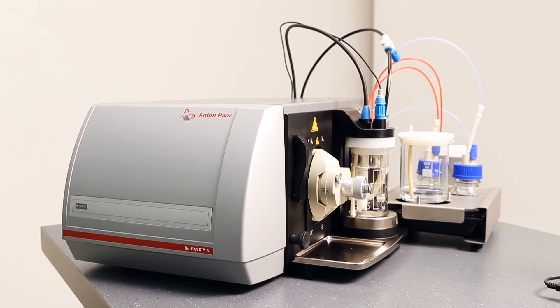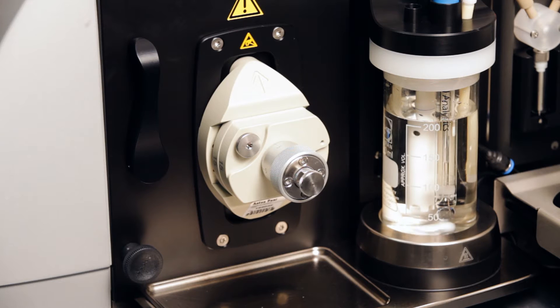Currently, sample holders are available that accommodate discs with diameters of either 14mm or 15mm. Applications cover sensor discs or substrates for incubation tests, for example.